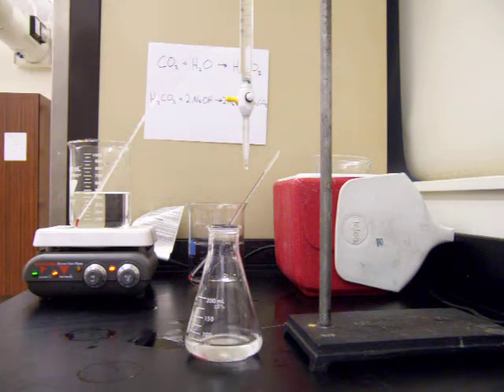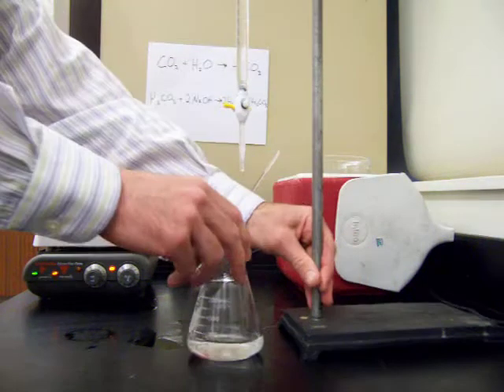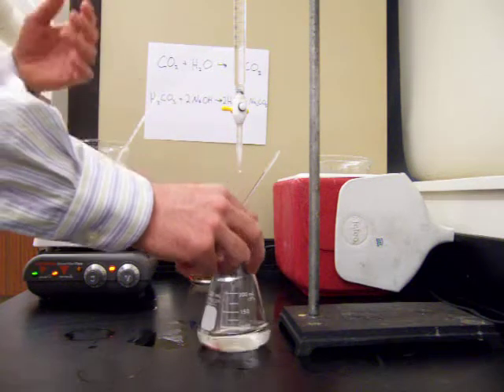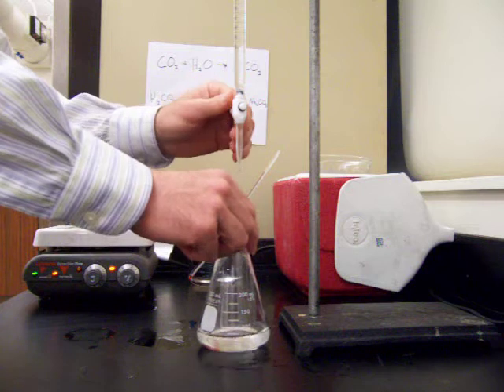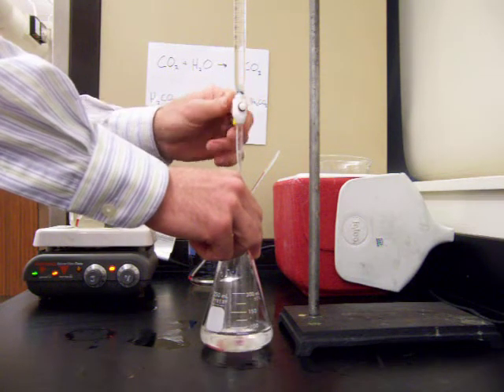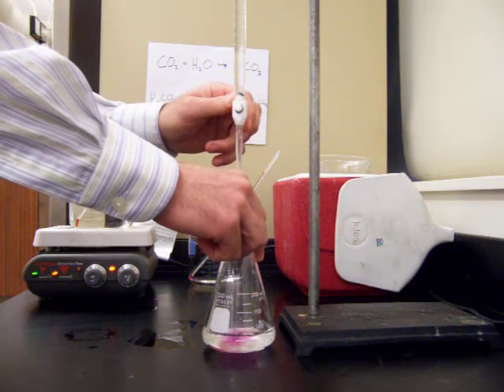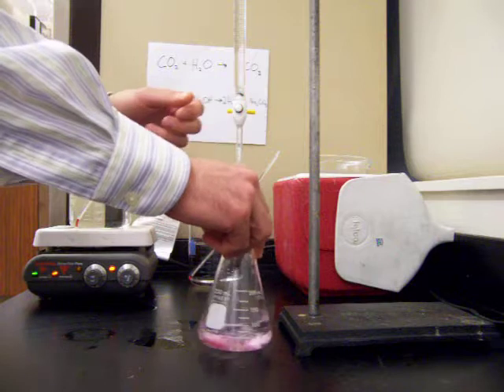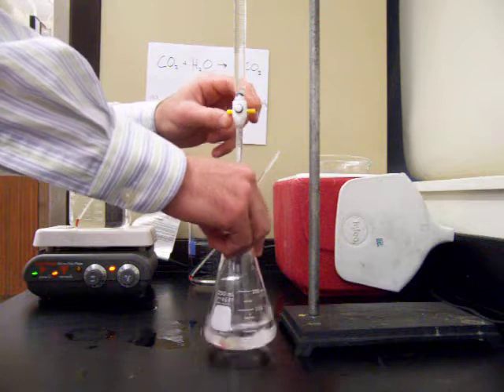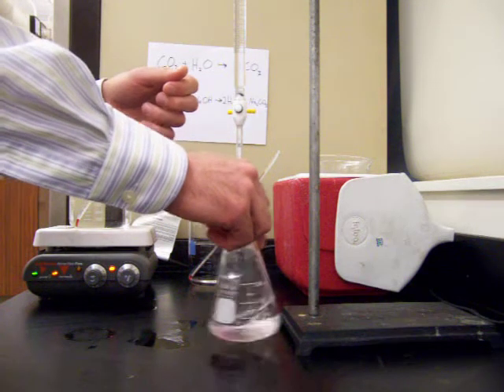The purpose here is to see if the colder solution has more or less carbon dioxide dissolved in the water — we're trying to find how the solubility of carbon dioxide in water is affected by temperature. Our starting volume on the burette is 12.1 milliliters, the same as the ending volume of the last trial. We'll do the same titration, adding sodium hydroxide slowly and seeing how much it takes to reach the equivalence point — where we have an equal number of moles of acid and base.